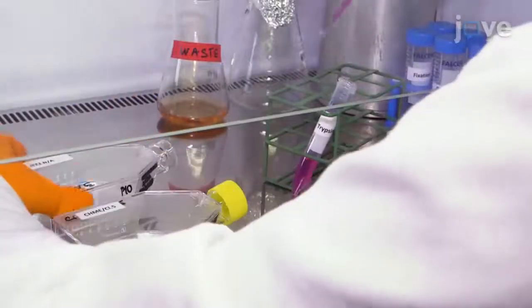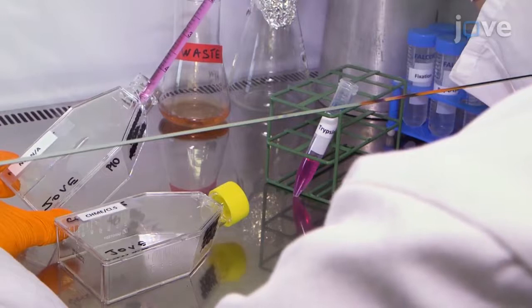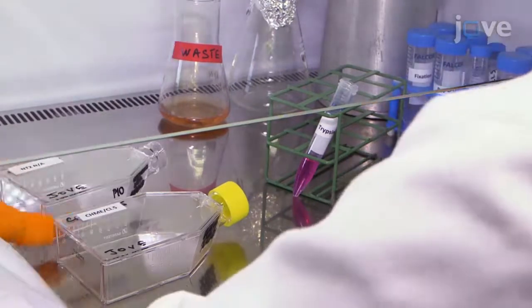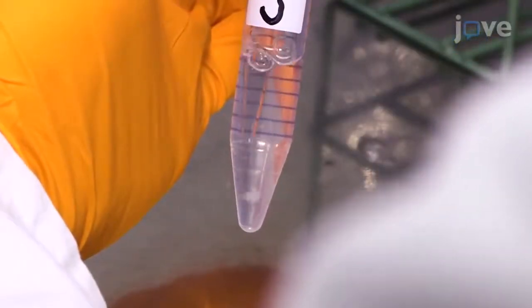To prepare the mini-brain, gently trypsinize the human neurons, astrocytes, and CHME clone 5 cells, and dissociate the cell pellets with complete endothelial cell medium.